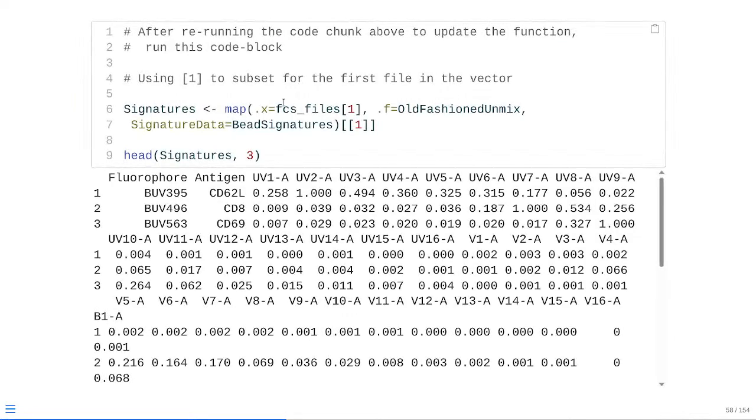So at that point, if we go ahead and run, as you can see, we're reading it in correctly in the context of if we read in bead signatures, and we're all set to go at that point in time.